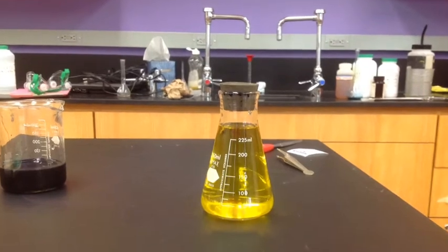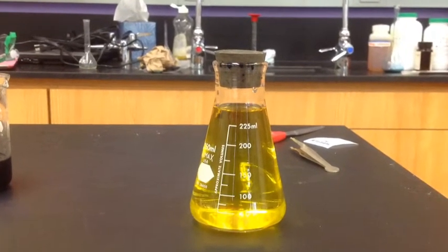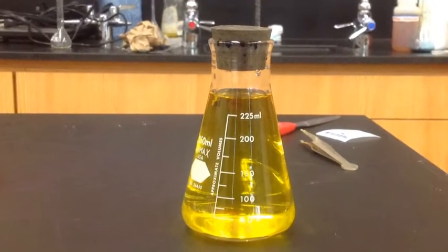As you can see, after sitting for 10 minutes, the solution is now light yellow, as we predicted because of the indicator at this pH level. Let's see what happens when we shake things up.